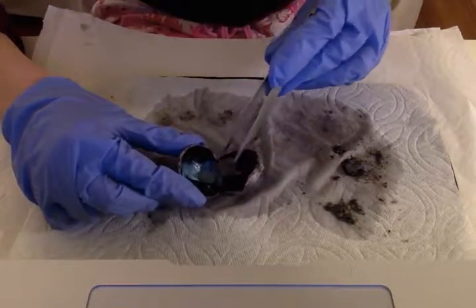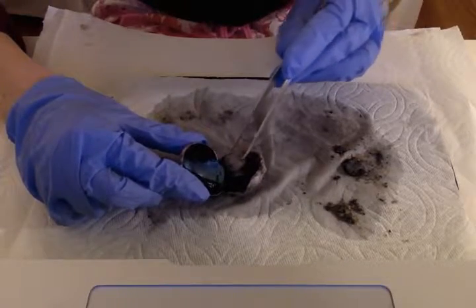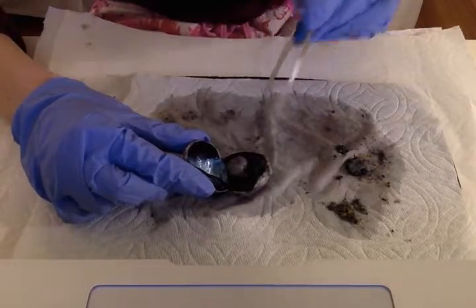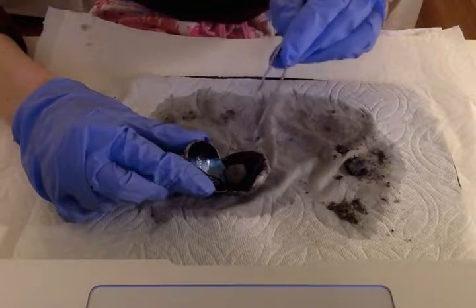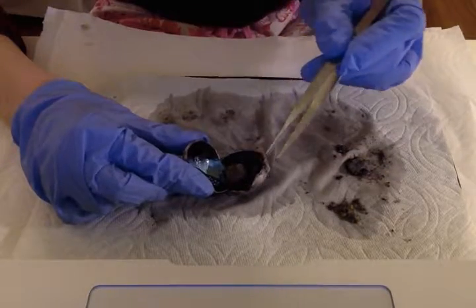Okay, now the lens, which is moving around now, is behind the cornea and the iris. It's the second place where light is refracted in the eye. The lens is attached to ciliary muscles that can stretch or loosen, and this changes the shape of the lens.